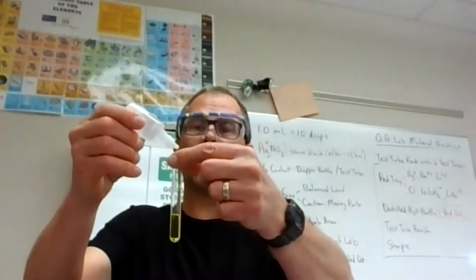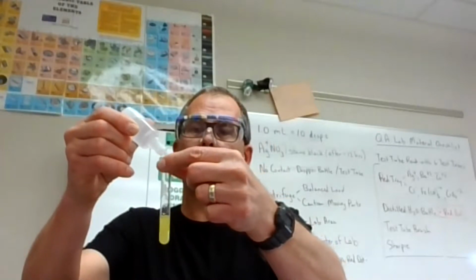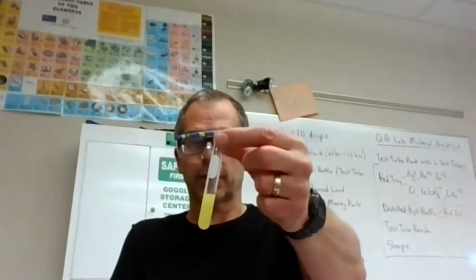This is the one where I look for precipitation right away. And not only oily, but getting cloudy. And we see that cloudiness forming right there. We're not going to centrifuge it, but we see that cloudiness as I add the drops, pretty much with the first or second drop starting to get cloudy right away, which is a typical positive response for this precipitate here in this last step.